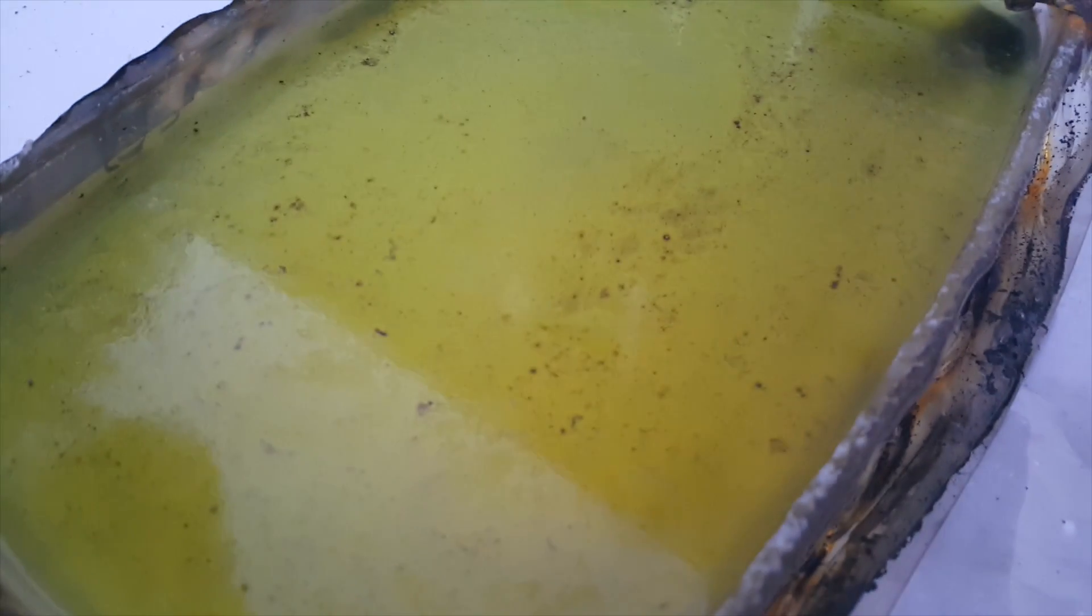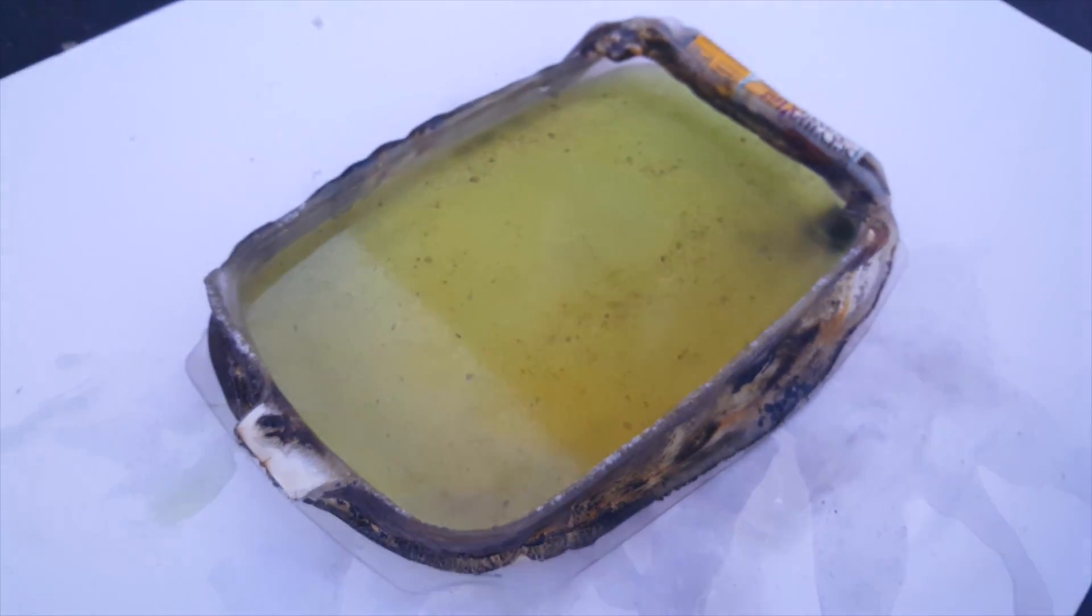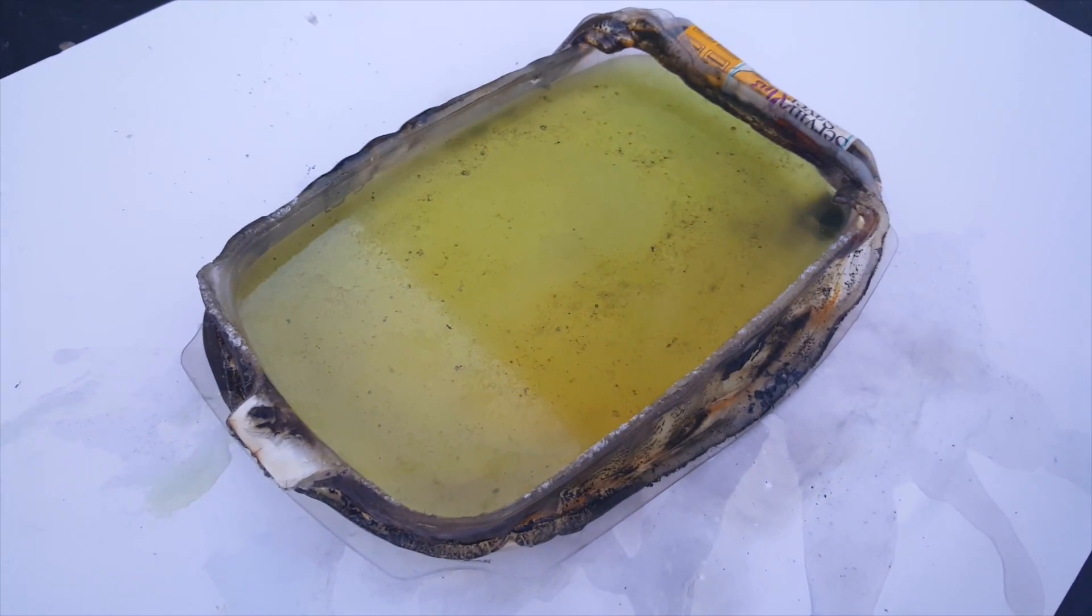After putting out the fire a second time, you can see the solution is changed to a green color, showing the presence of high pH and the sodium and potassium hydroxides. Oh, and of course all the pieces of my old burnt plastic container.